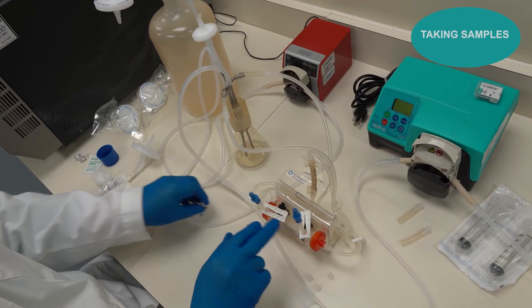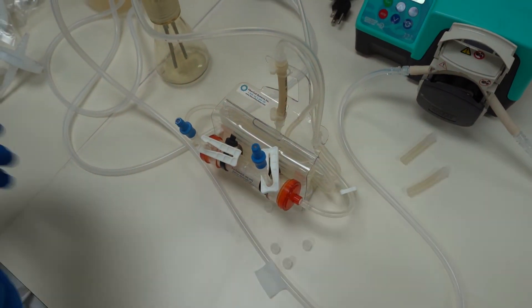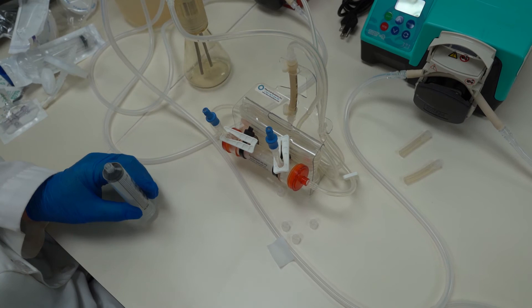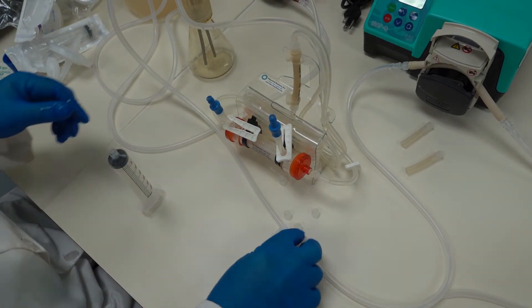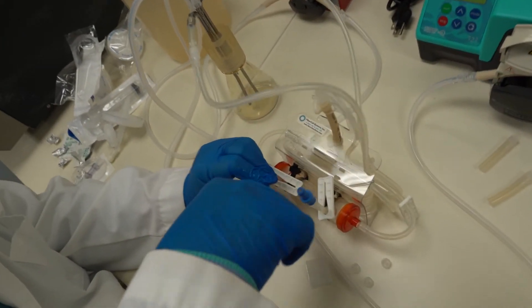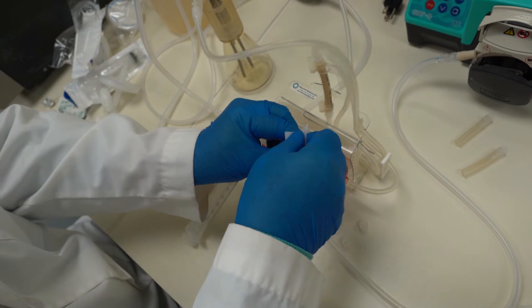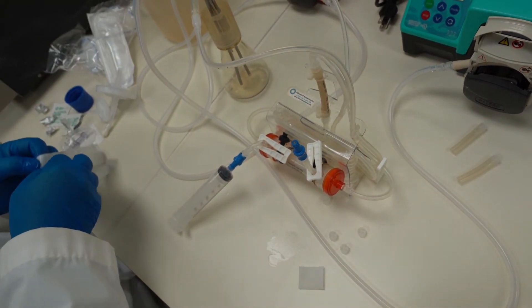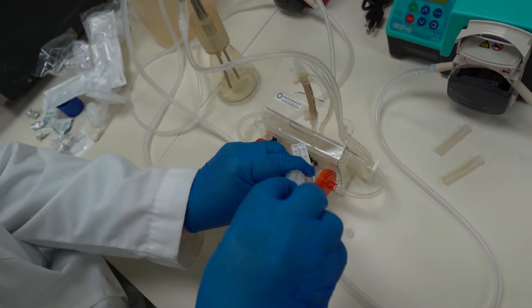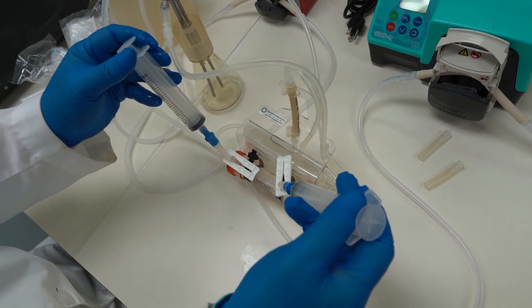The next thing that I just want to focus on is going to be fastening these claves. Because they're set up so that we're going to sample aseptically. This you'll sample many times an hour sometimes. Be sure that you wipe it down. And that's how we can perform samples in the incubator.